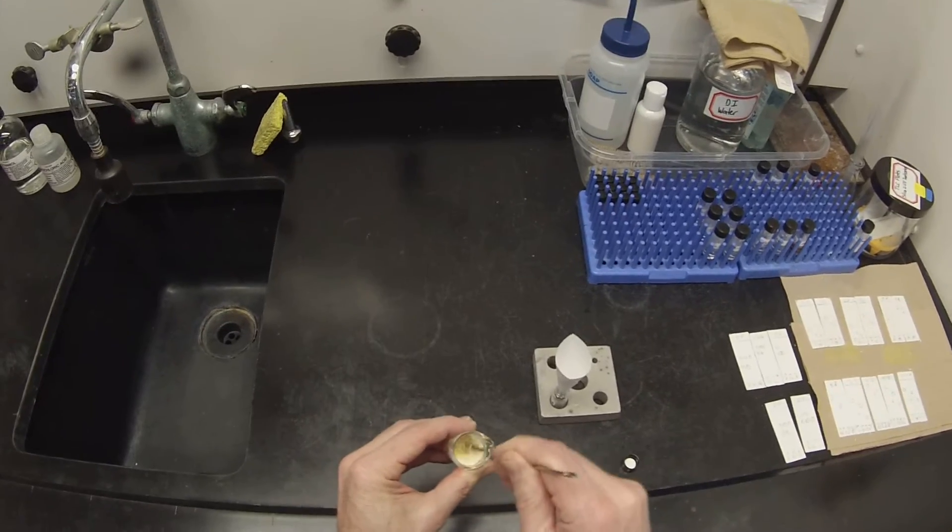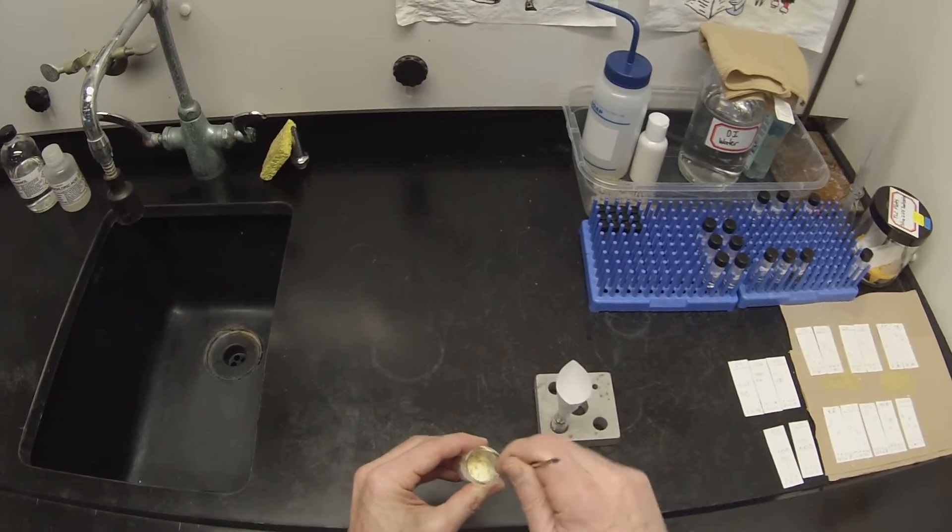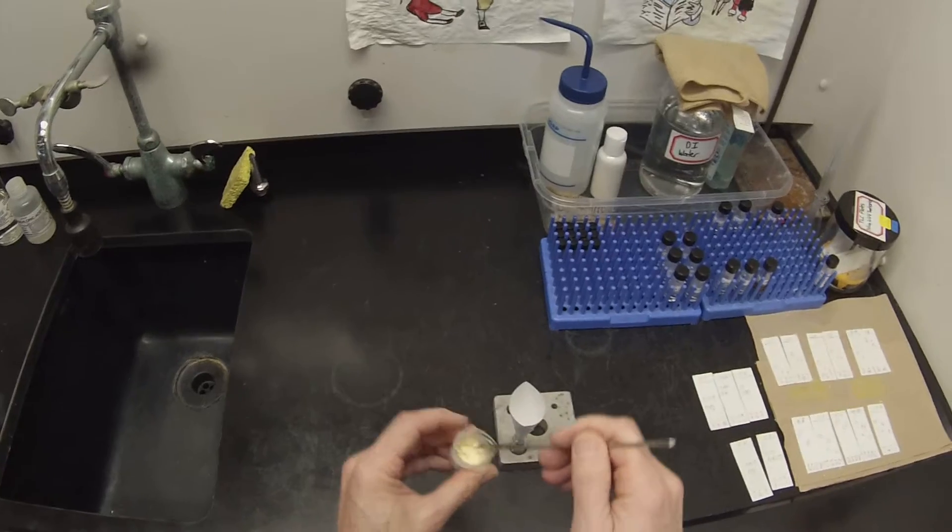And I've already run GC mass spec on this. So this is just sitting around until such time as the NMR is working again.